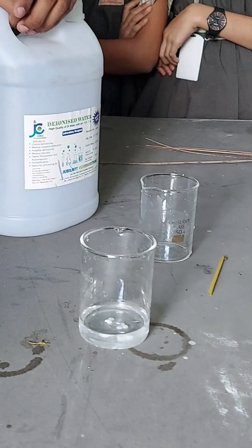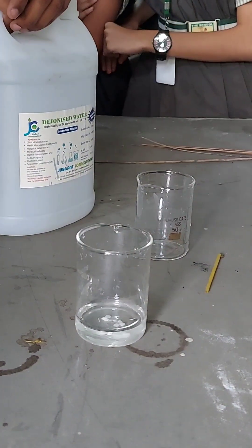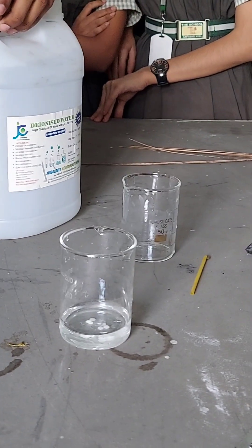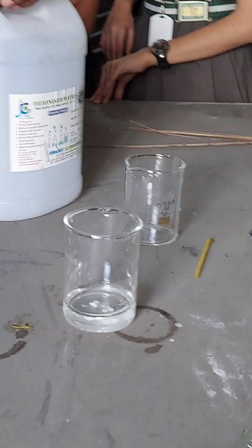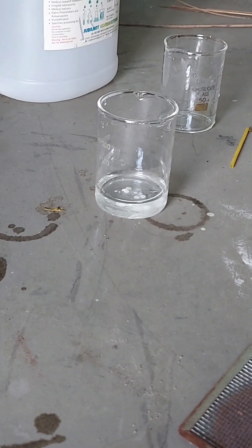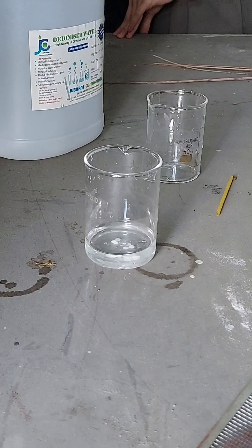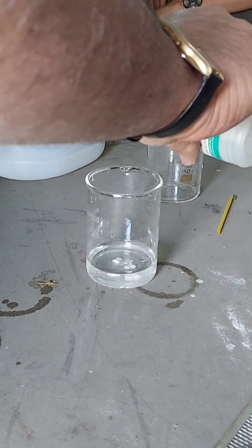Phenolphthalein. Is it getting into the water? Yes. Okay, we will add some phenolphthalein to this.